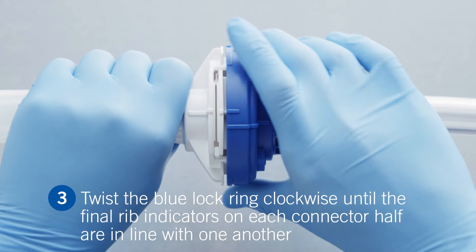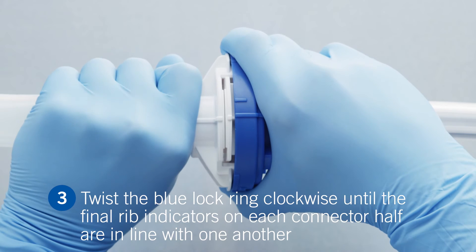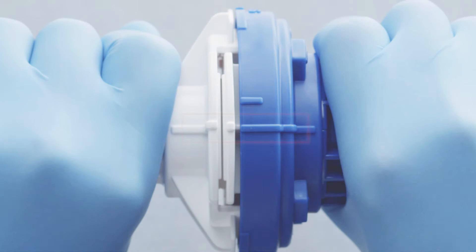Twist the blue lock ring clockwise until the final click is heard. Alignment of the long blue rib indicator with the white rib indicator confirms the final rotation is complete.